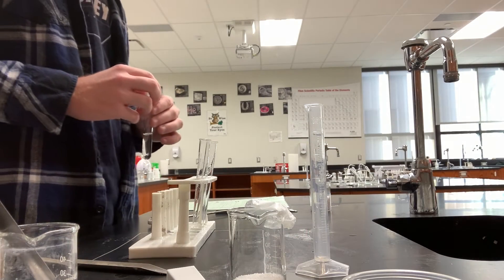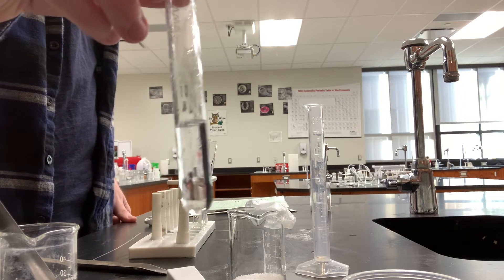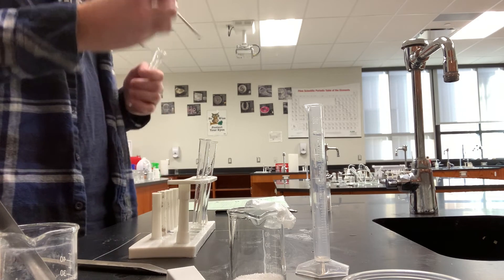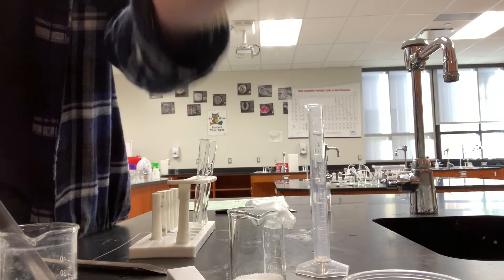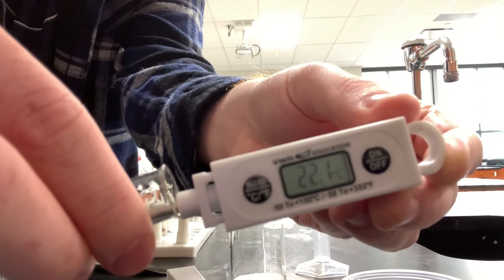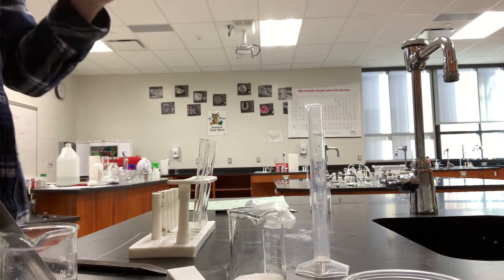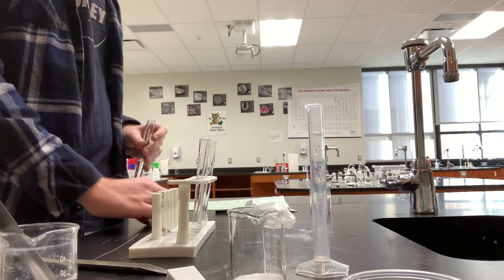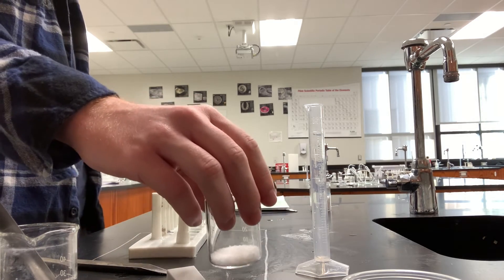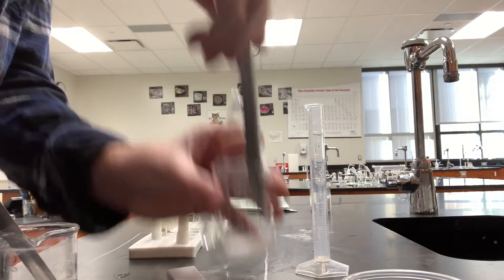This is part three of the lab. I've got about 10 milliliters of water in this test tube. We're going to take a thermometer and see what the temperature is. It's about room temperature, about 22.1 degrees. Right here we've got some magnesium sulfate, and we're going to add that into the water.